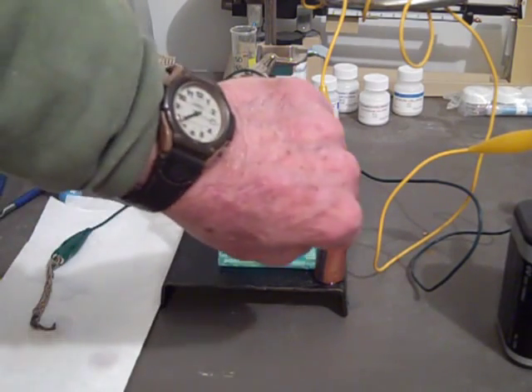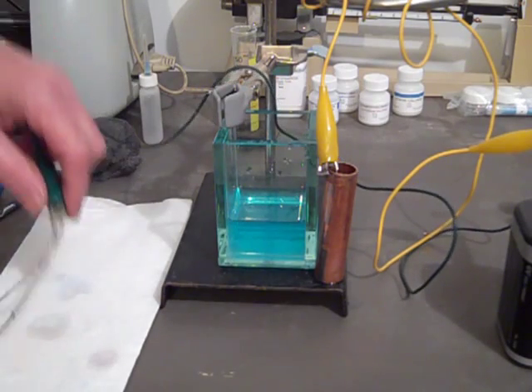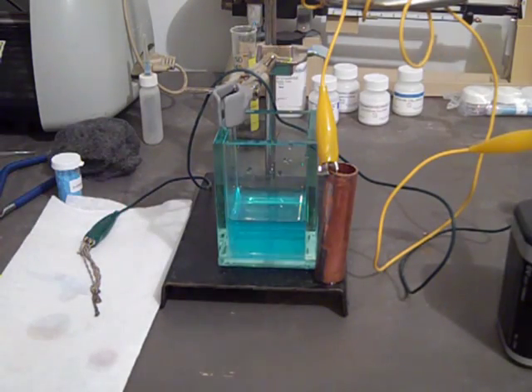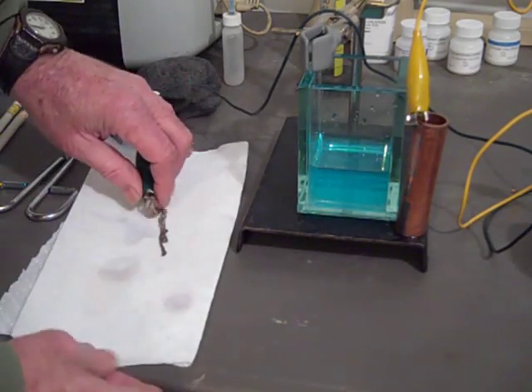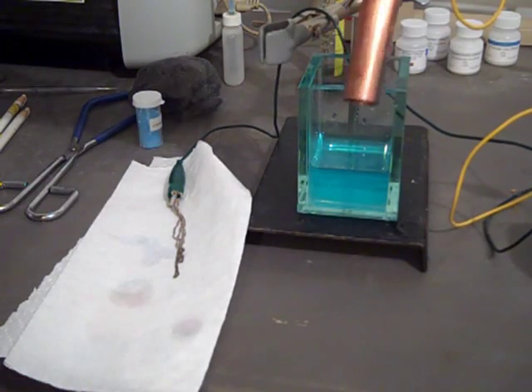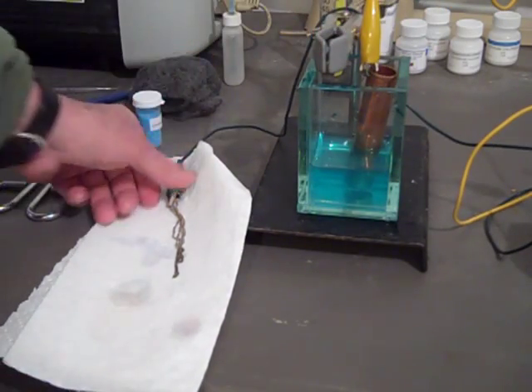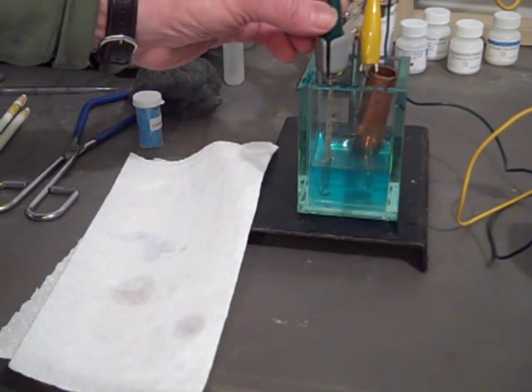We had a little battery failure, so we're about three minutes late. We already took out the silver string — you can see it's still fairly brown as it was, after about four minutes. Here's the copper — no change, no expected change. Maybe it wasn't clean enough. We tried cleaning it. We're going to put it back for another two minutes or so and see if we have any further change.